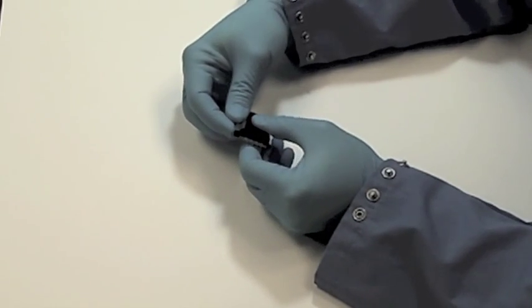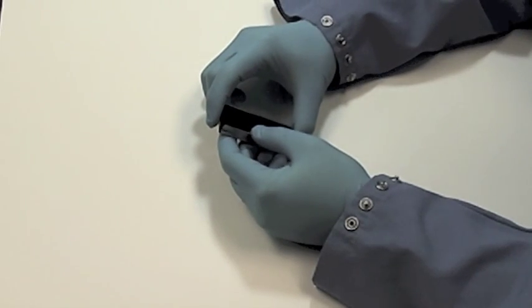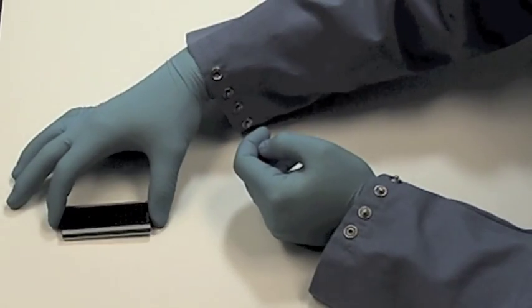Then the clips are attached to the chambered slide by fitting the clip into the groove on the chamber module and pressing down until the lower edge wraps around the slide and clicks into place.